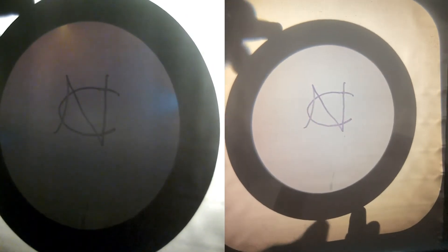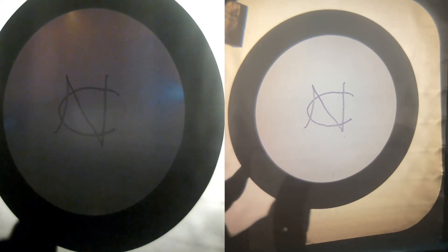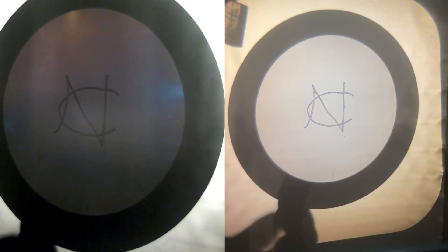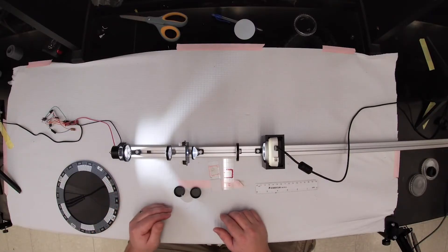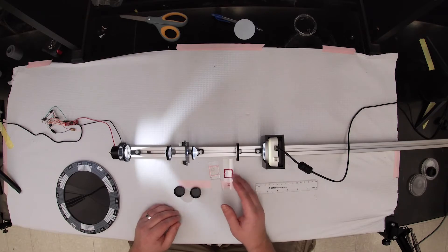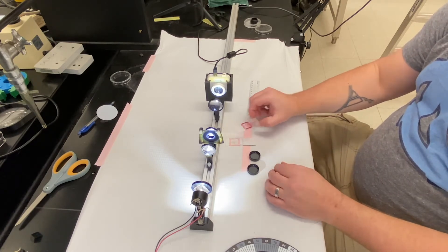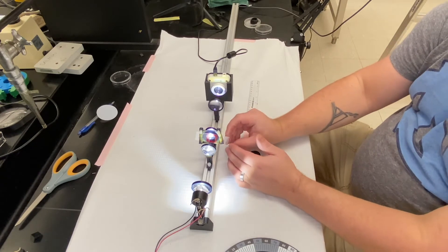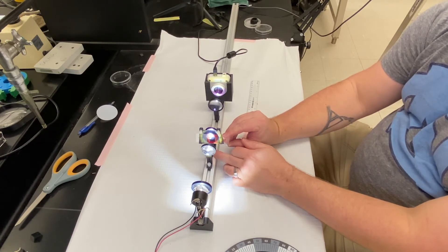Now we'll use this information about polarized light and begin to probe biological samples by installing these two filters on our pre-existing Kohler microscope. By now you should be familiar with the Kohler microscope setup: our LED, collector lens, condenser lens, sample plane, objective lens, our 3.5X tube lens, and our camera. You're not seeing anything on the camera feed because I don't have a sample mounted yet, but I'll be putting up the hair sample as before, to provide a nice contrast for when we introduce polarized light into the system.